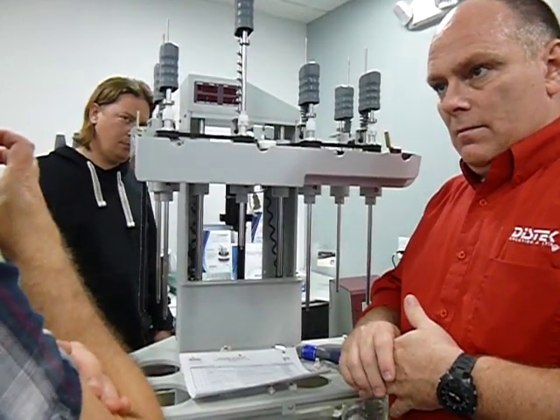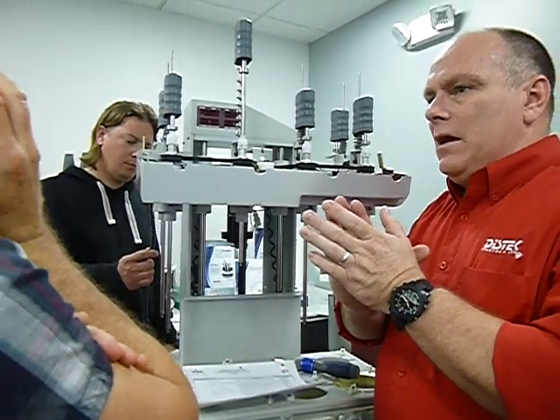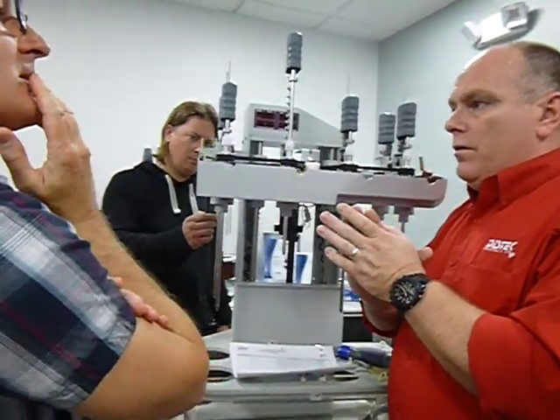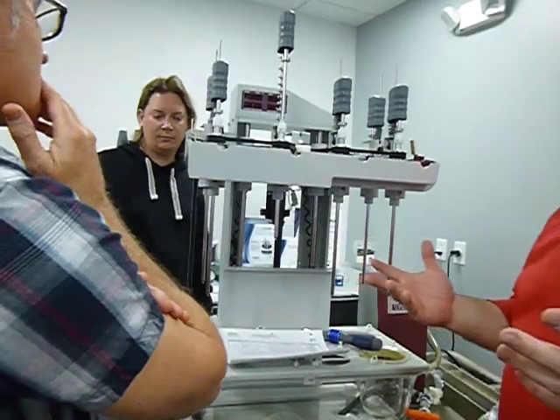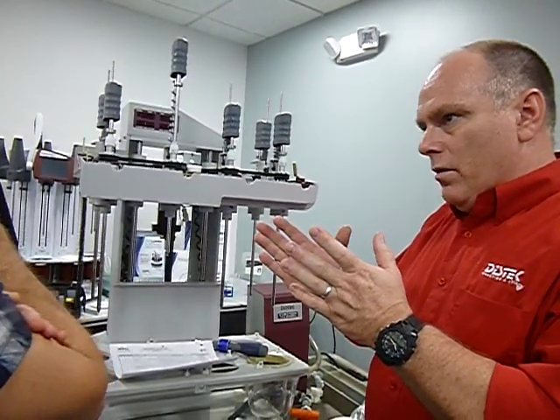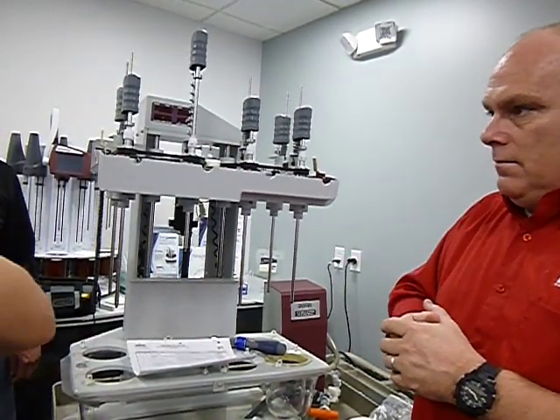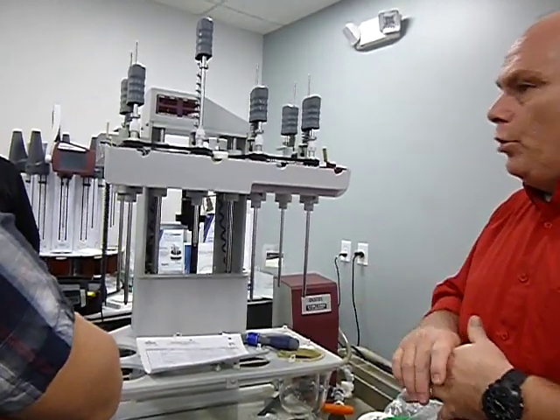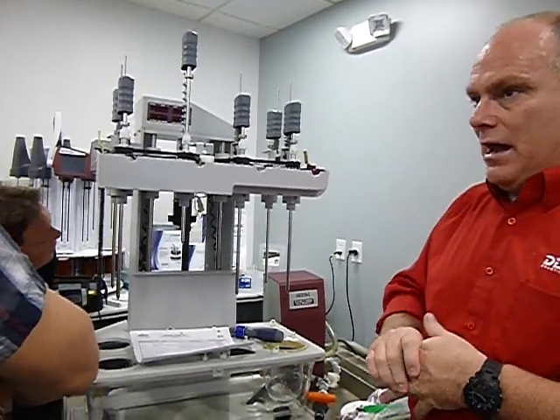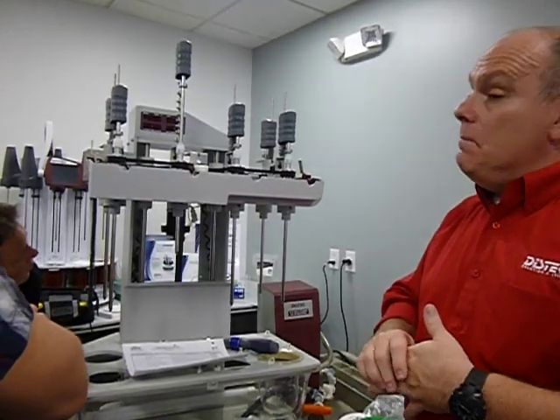Well, put it as close as possible, but not to catch the gear, right? I'll put it as close as I can, and then I'll slowly start backing it off. And then you'll get to a point where the motor spins really fast, because it doesn't read anymore. So then you just adjust it in a little bit more, back to where it starts picking it up again. And at that point, that's when I tighten the nut down. So again, I typically don't use the gap of the feeler gauges and adjust the gap, just because it's a recommended setting. It's not a must setting.